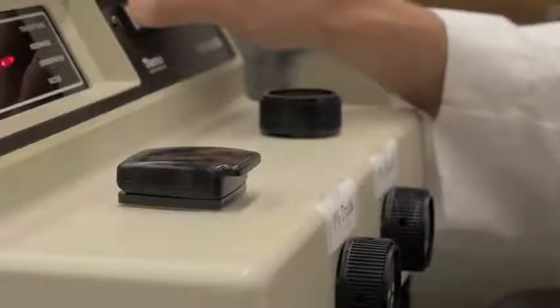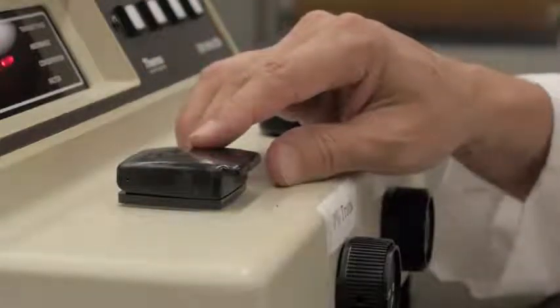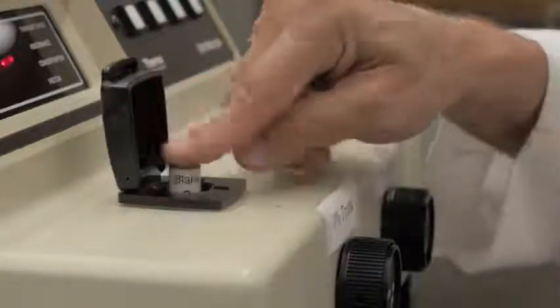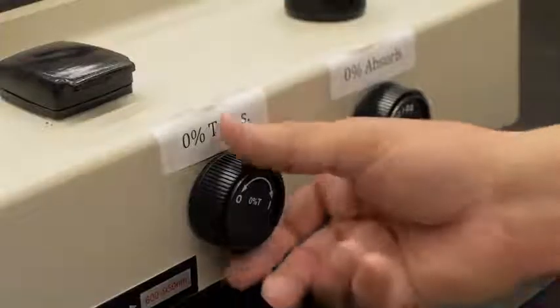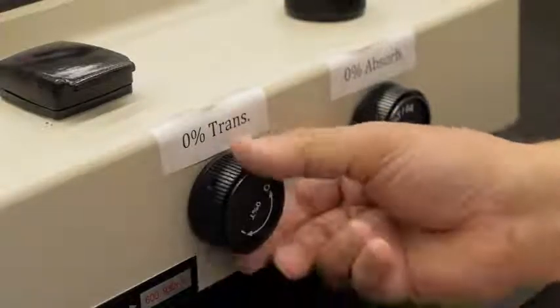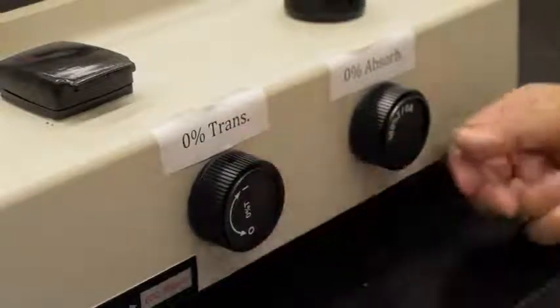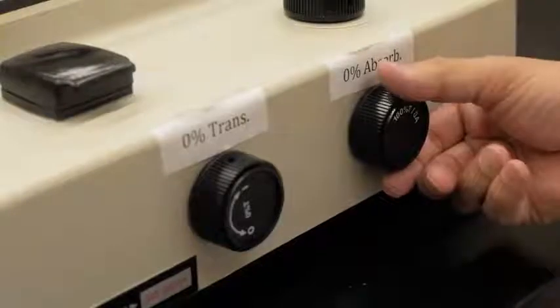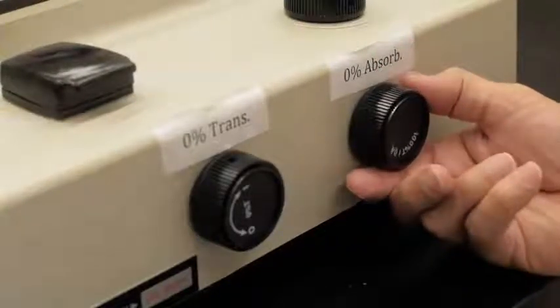These data characterize your sample. The sample holder receives the test tube or cuvette containing the solution. Inside the sample holder, the filtered light passes through the sample. The spectrophotometer is calibrated to zero transmittance by adjusting the zero transmittance knob. The spectrophotometer is also calibrated to zero absorbance by adjusting the percent absorbance knob.